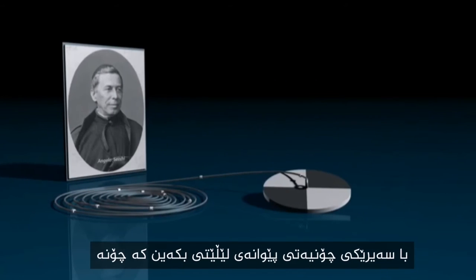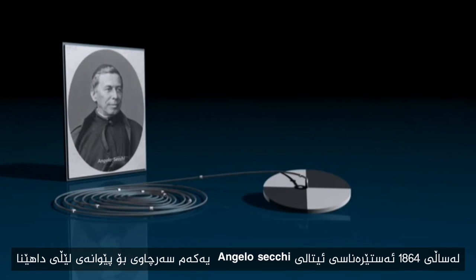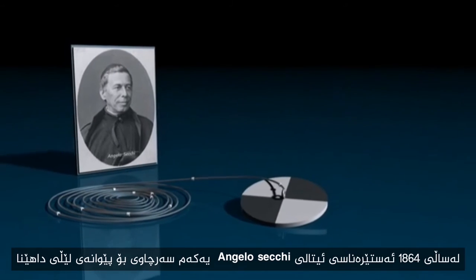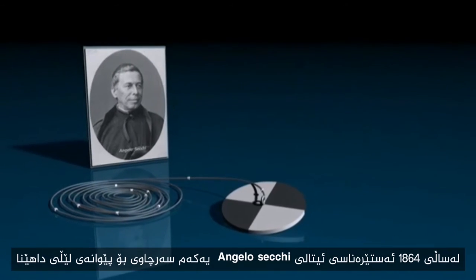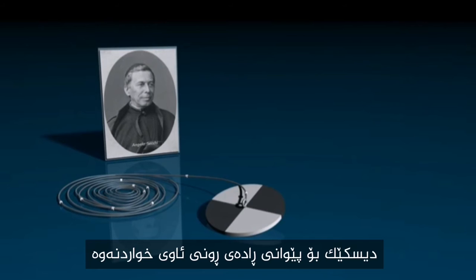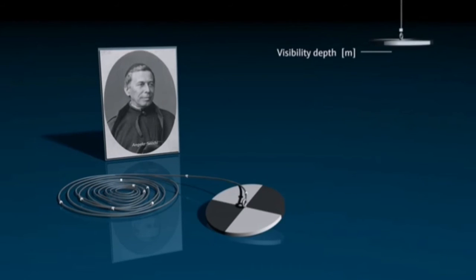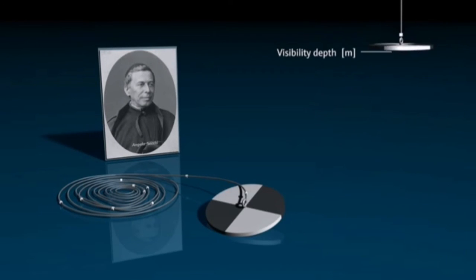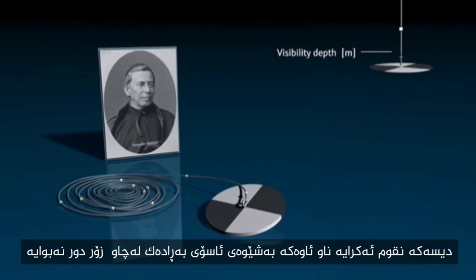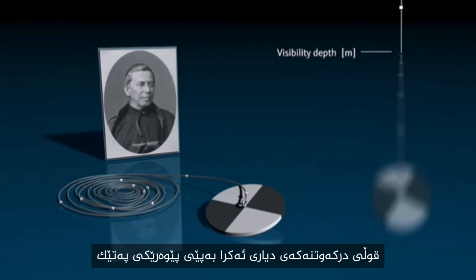Let's take a look at how turbidity measurement works. In 1864, Angelo Secchi, an Italian astronomer, invented the first reference for turbidity measurement — a disc used to measure water transparency in bodies of water. The disc is lowered into the water in a horizontal position until it is no longer visible, and the visibility depth is then determined by the rope scale.